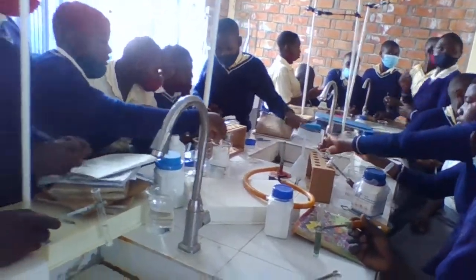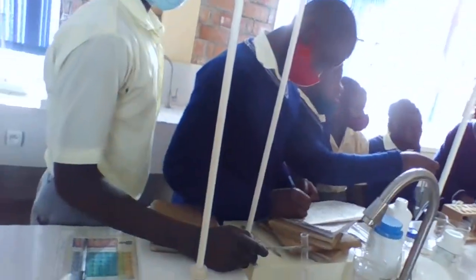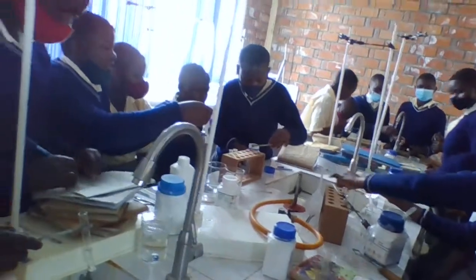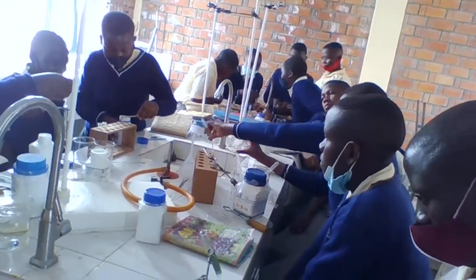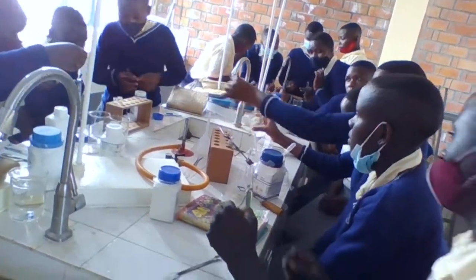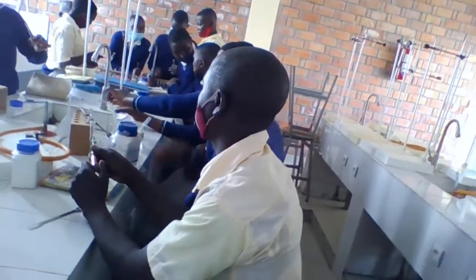Yes? What do you want? Dropper. Come here and take them. Pass this side. You take these droppers.